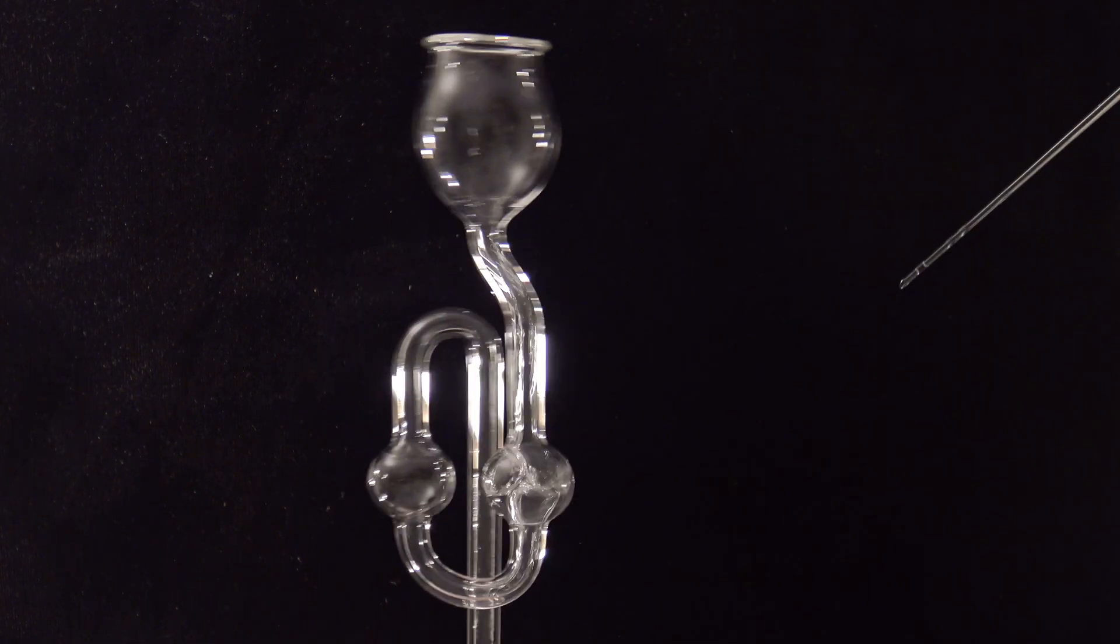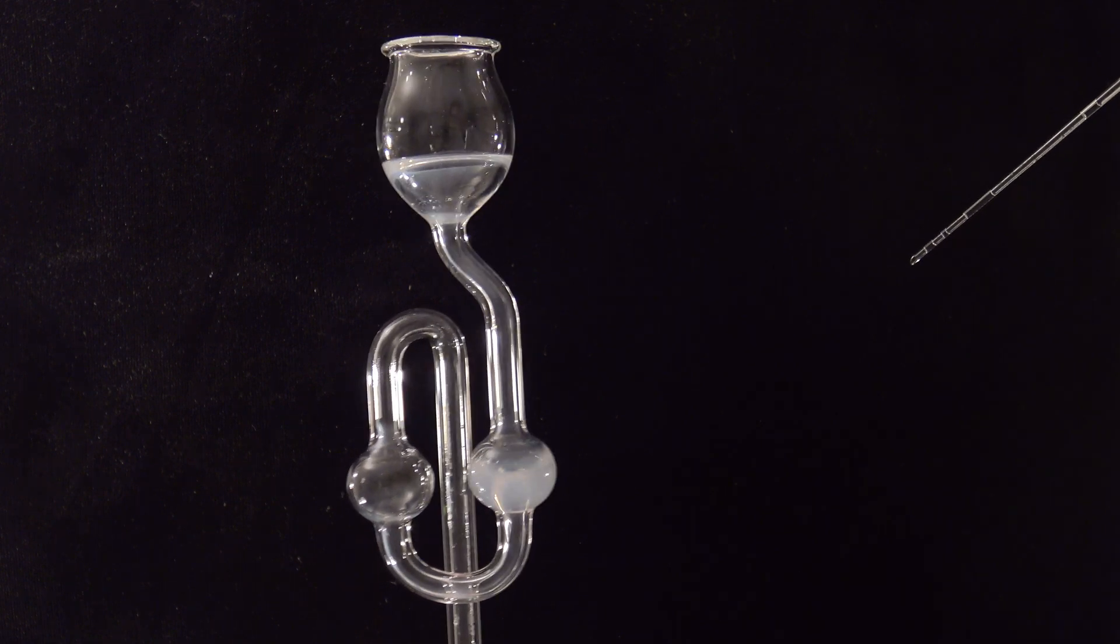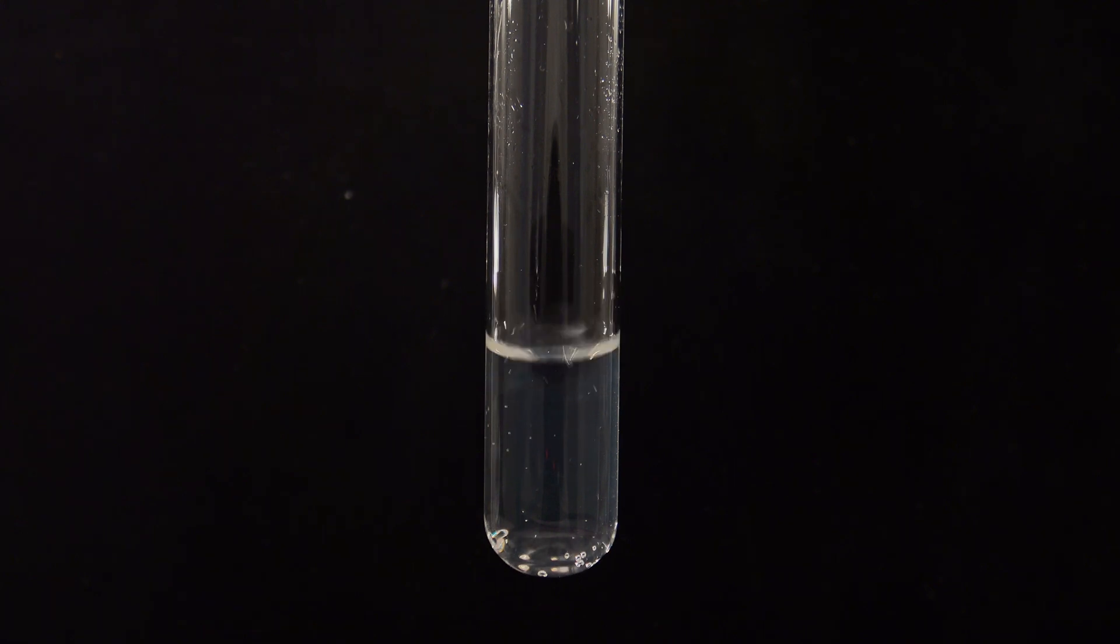This was the determination of anions in wood ash. I hope you enjoyed, please rate and comment. If you want to see the determination of the cations in wood ash, you can watch my video here, or you can watch my latest video here.